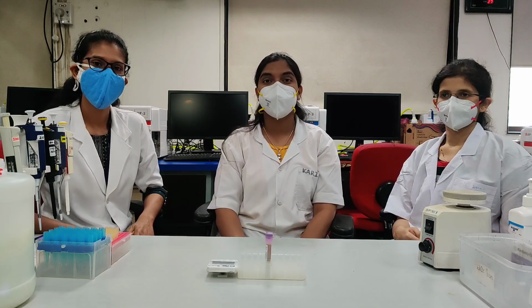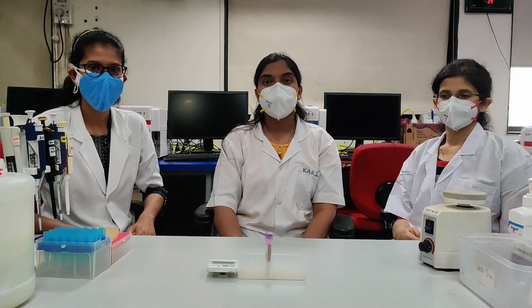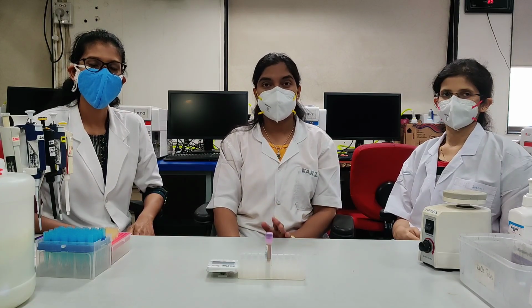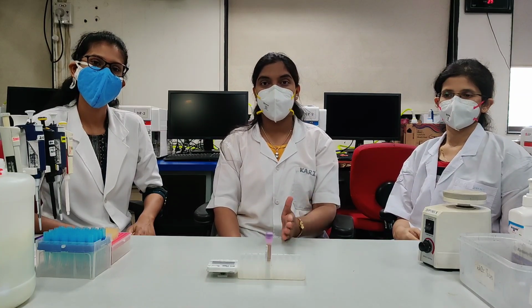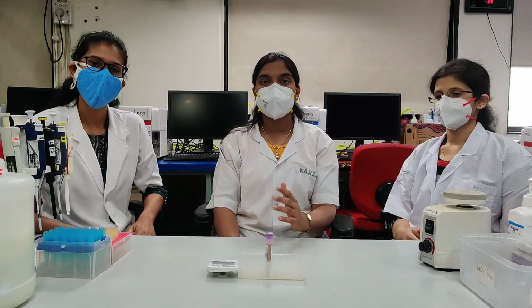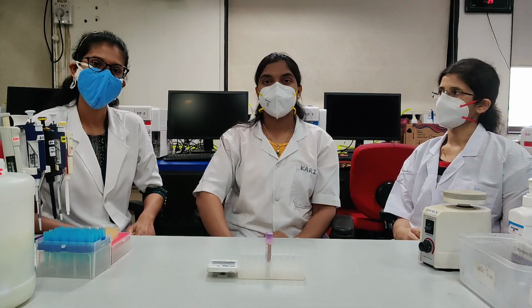For stem cell enumeration, in our lab we receive peripheral blood and apheresis product. Samples are received in EDTA or heparin vacutainers. Once the samples are received, they should reach the lab as soon as possible at 18 to 25 degrees Celsius. Once the samples are received in the lab, check the patient details and match with the requisition. Check for hemolysis or clots. Clotted peripheral blood should be rejected.